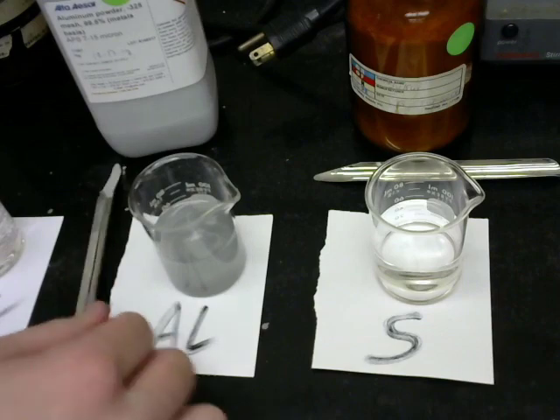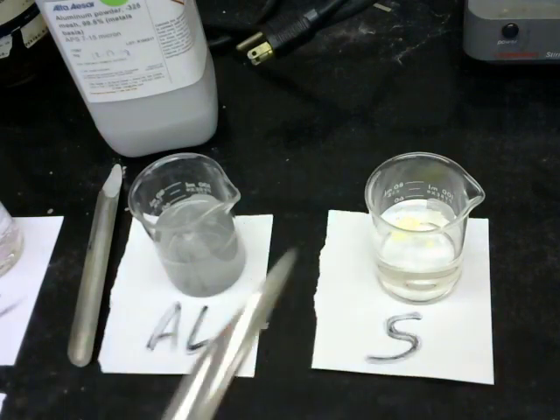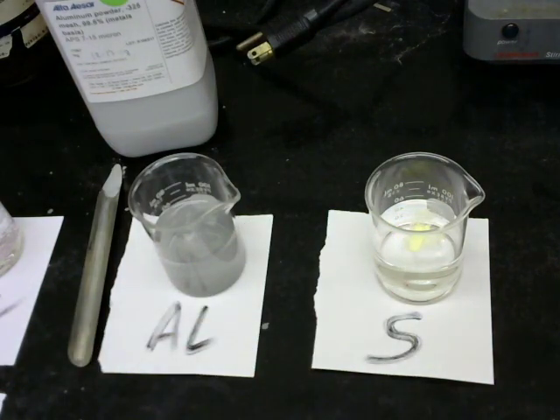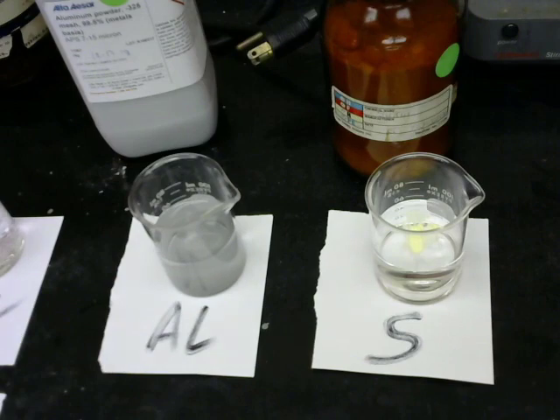And sulfur as well. This is our only non-metal. Of course, sodium, magnesium, and aluminum and sulfur are all on the same row of the periodic table. And so they are going to help you to see the reactivity trend across the row. And here is the sulfur. It's a yellow, smelly solid. Okay, now I'm going to leave these for about an hour. I'll use some time acceleration, so it'll be a few seconds for you. We'll come back in an hour and see how the sulfur, the aluminum, and the magnesium look after that time period. Okay, Gene, let's clean up.